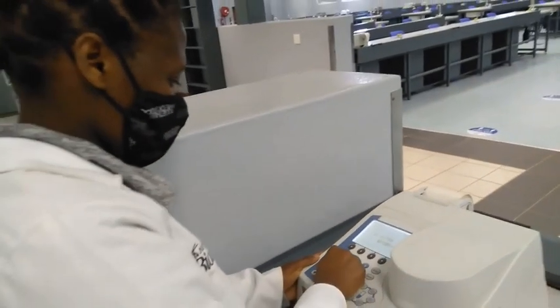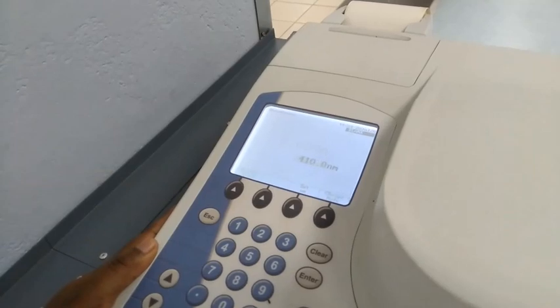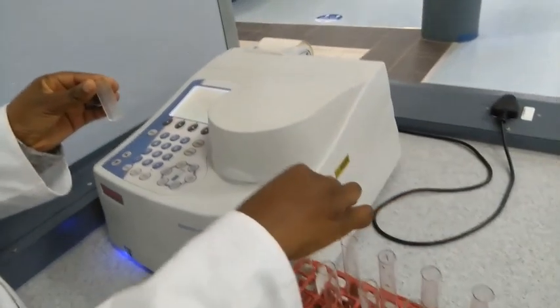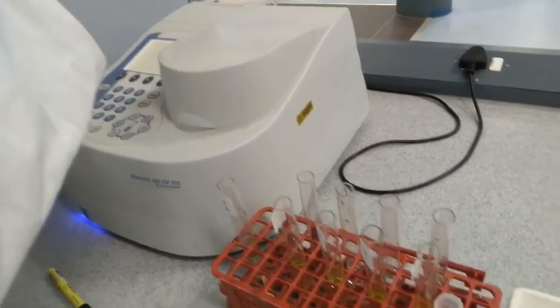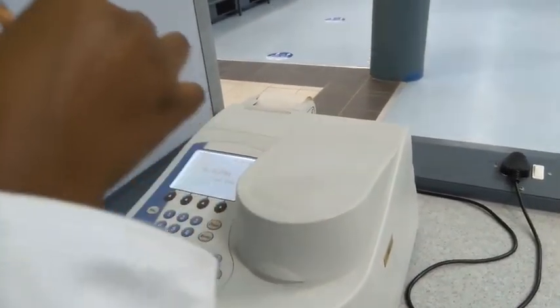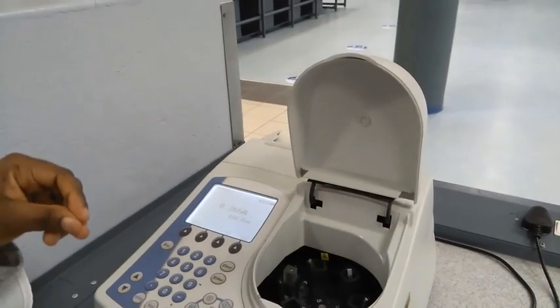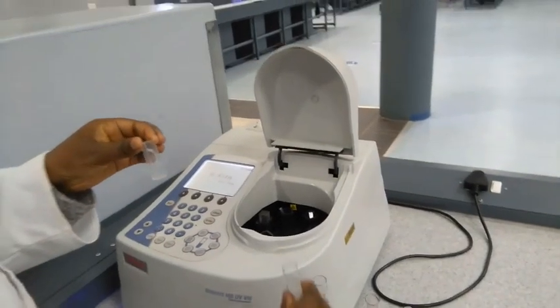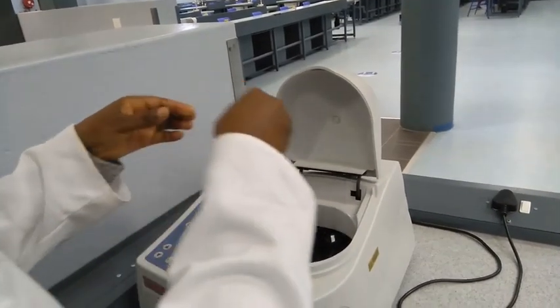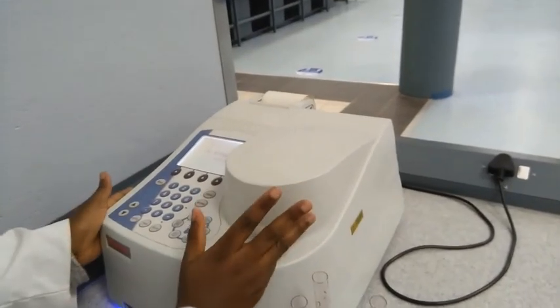We'll tell our spectrophotometer we're going to measure at 410 nanometers of wavelength. Remember, we had duplicates — in one tube we had the enzyme and in the other we did not. We can use the tube without the enzyme to blank the spectrophotometer. According to Beer-Lambert's law, particles of the substrate will absorb some light, and we will zero that out by using the tubes without the enzyme as blanks. That is where the duplicate tubes become useful — we use them as blanks for the tubes containing the enzyme, so we can measure the color from the enzyme reaction alone.